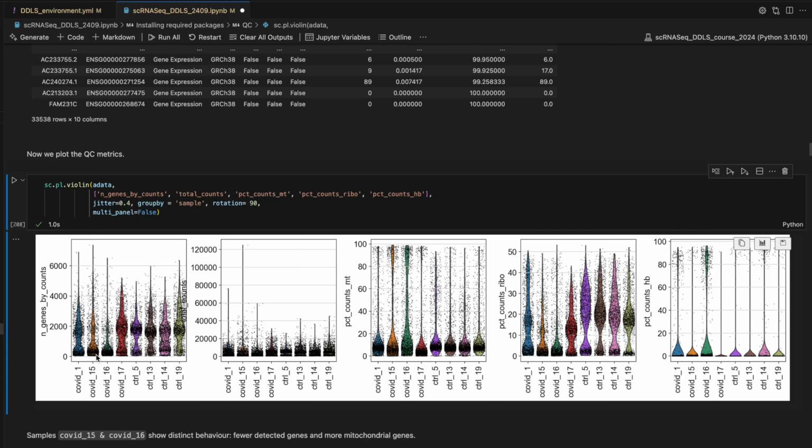At first glance you can see these two samples, COVID 15 and 16, tend to have lower genes by counts. We will come back to that. In addition to that, the total counts look okay-ish, and then in the percentage of mitochondria, we do see some differences already. For example, COVID 15 and 16 tend to have cells with higher mitochondrial expression. So at the end of the tail of the distribution, we see a larger cloud of cells. And COVID 17 as well, which shows lower percentage of mitochondria, which is not a bad thing. I will talk about that in the next few minutes.